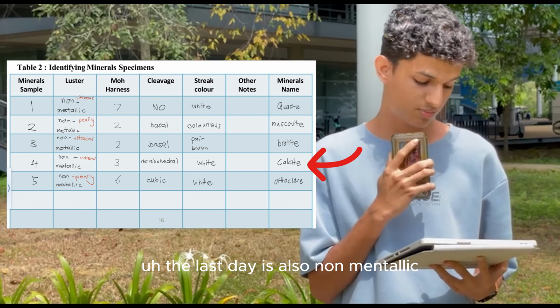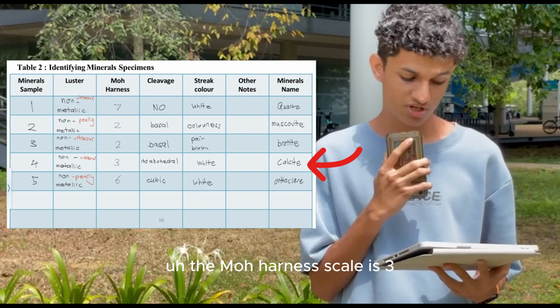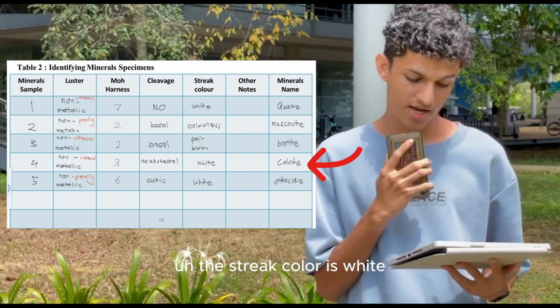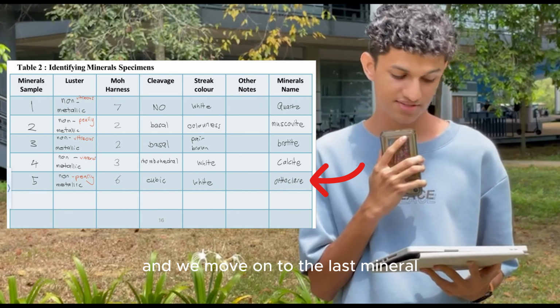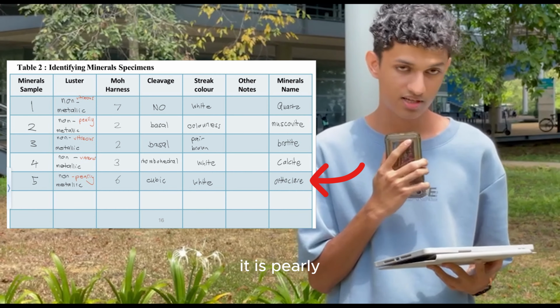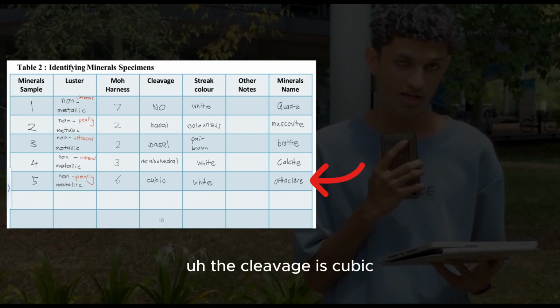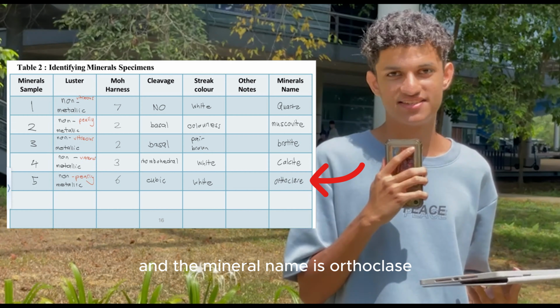The luster is also non-metallic. It is vitreous. The Mohs hardness scale is 3 and the cleavage is rhombohedral. The streak color is white and the mineral name is calcite. And we move on to the last mineral. The luster is non-metallic. It is pearly. The Mohs hardness scale is 6. The cleavage is cubic. The streak color is white and the mineral name is orthoclase.